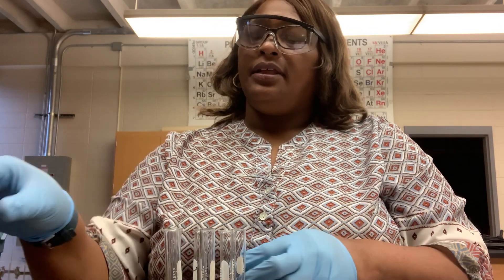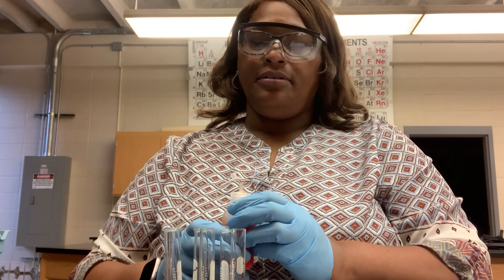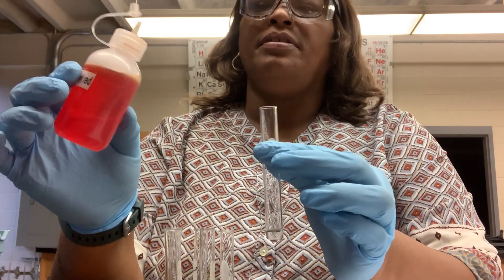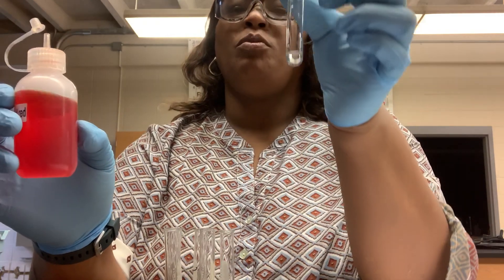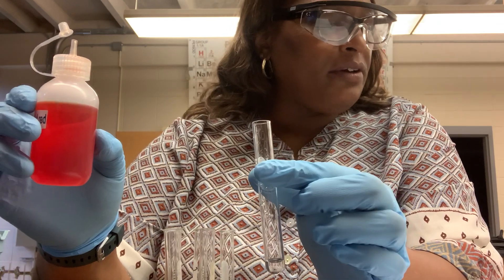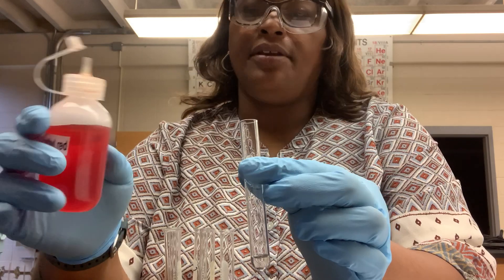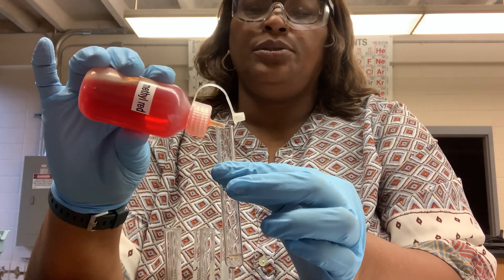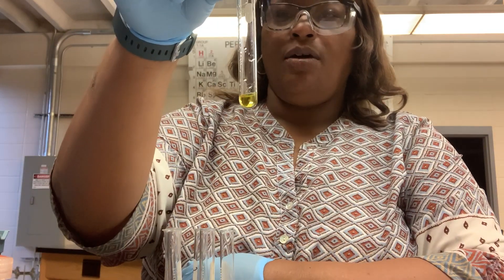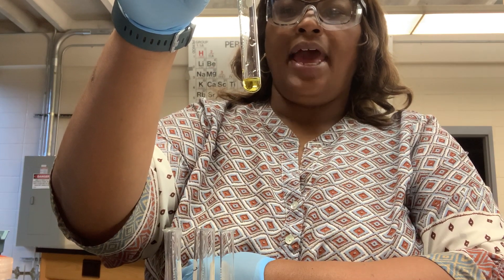First, let's use the methyl red indicator. Let's add the methyl red indicator to the tap water. I have about one milliliter of tap water in this test tube. I'm going to place two to three drops of indicator in this test tube. I'll shake to mix, and we note the color of the methyl red indicator in the tap water.